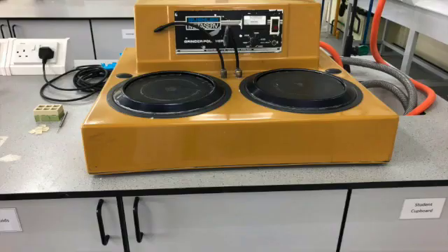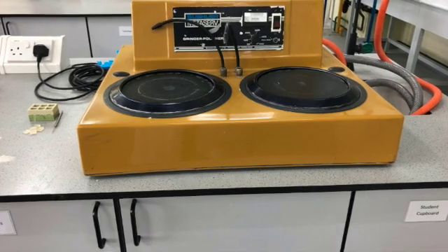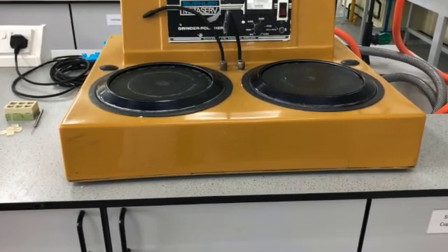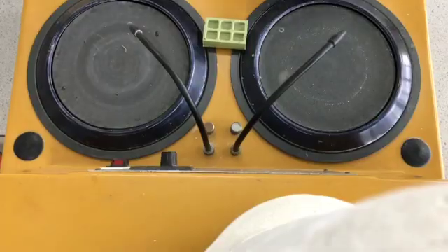Let's consider what happens next in the preparation of the cross section. Here you'll see a polisher grinder — the left hand side is the grinder, the right hand side is the polisher.